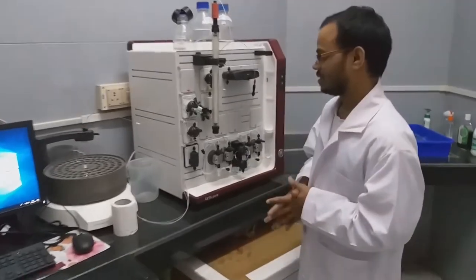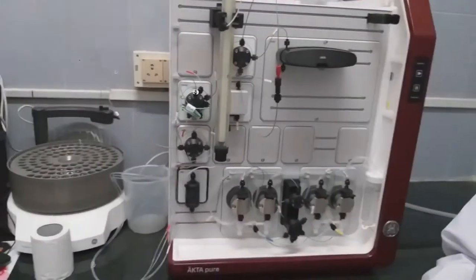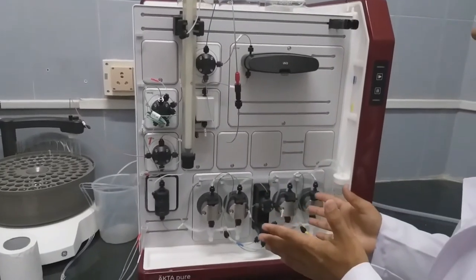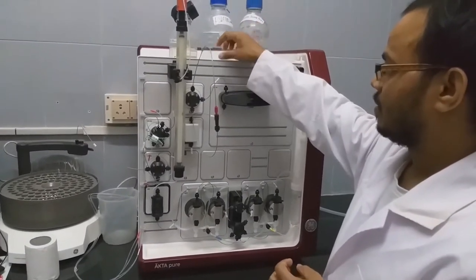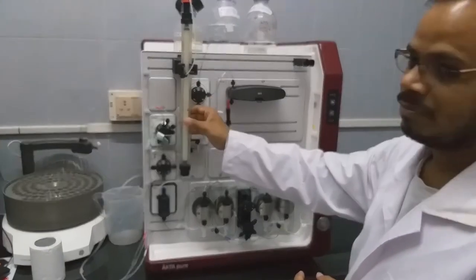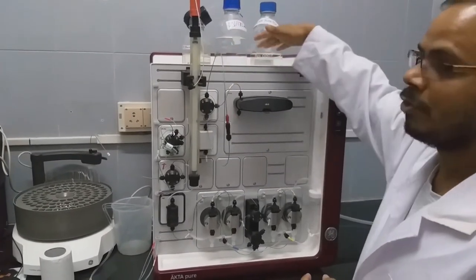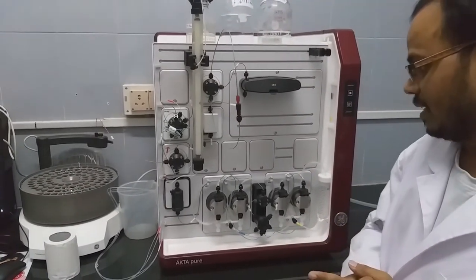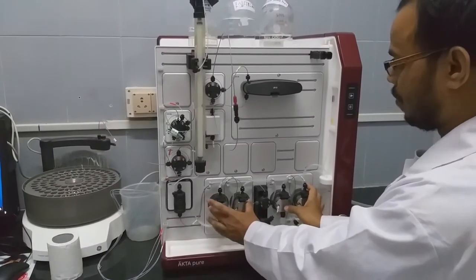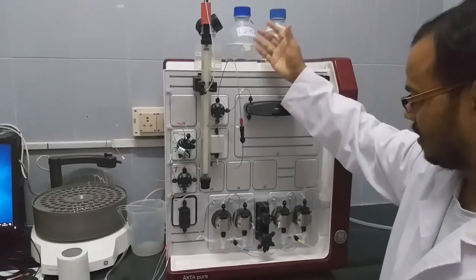Let us see what components the instrument contains. This is the instrument, connected to a computer system for observation purposes. It contains a stationary phase — this is the column — and a mobile phase, meaning buffers. This is the area where we keep all the buffers. It starts with the pumps. These two are pumps — pump one and pump two. Whatever buffers are coming from the buffer tray, they will enter here. The pressure from the pumps can be regulated here at the pressure monitor.